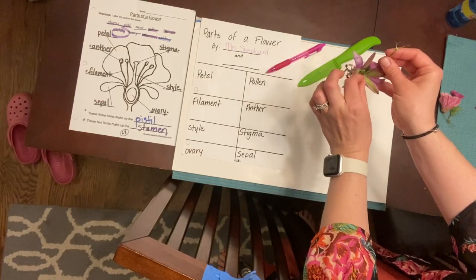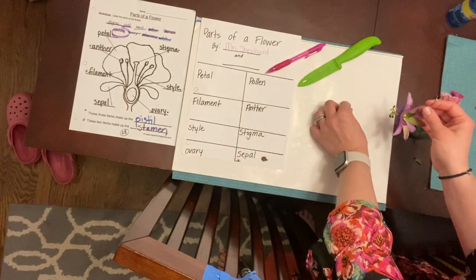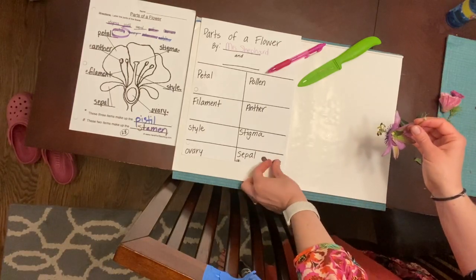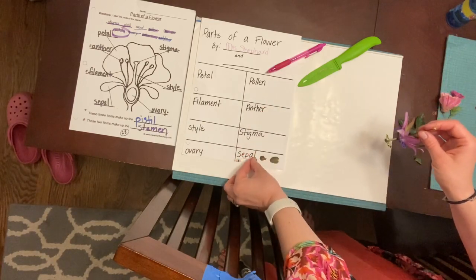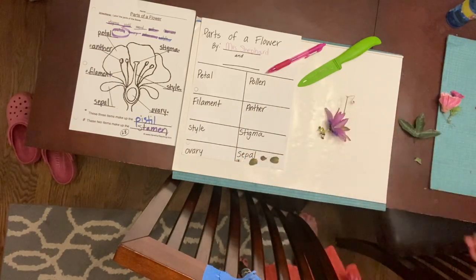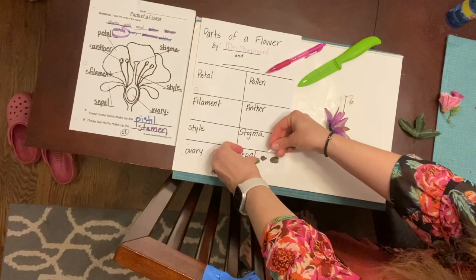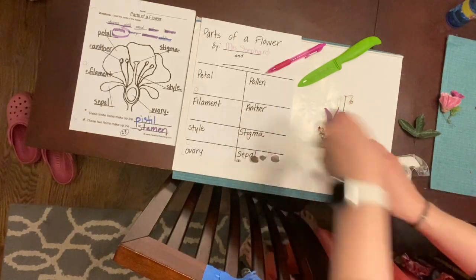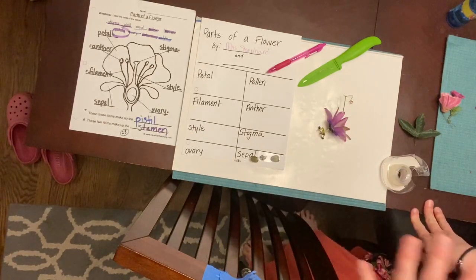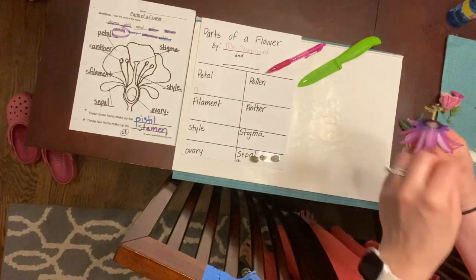So I'm going to just take off the sepals and I'm going to place them on my paper down where it says sepal. And you can use tape to tape them on, or you can just draw them or just leave them there and then eventually take a picture. I'm going to tape it for right now. But again, you can just set them there and draw them later. You can tape a couple examples, or you can not tape them and just take a picture to remember. Okay?